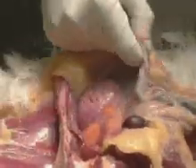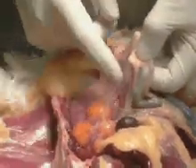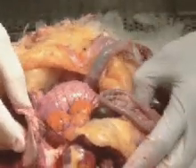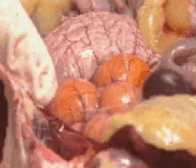The digestive tract can be reflected, and as we reflect we see air sacs. This can be removed by blunt dissection, and in this broiler breeder hen we see the ovaries showing a nice normal hierarchy of follicles.